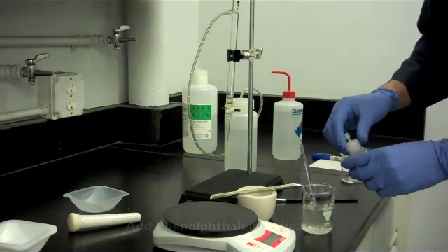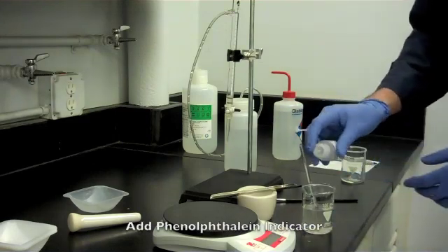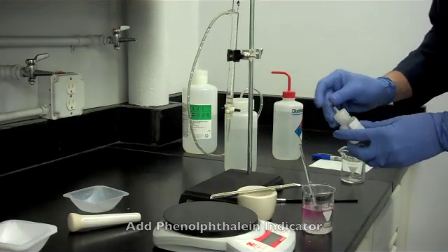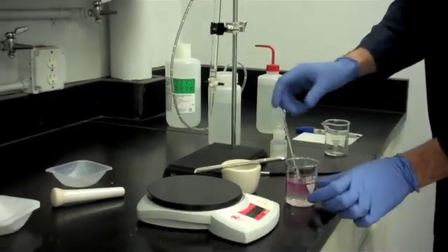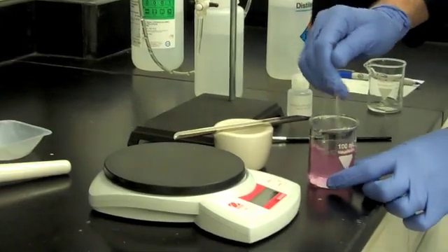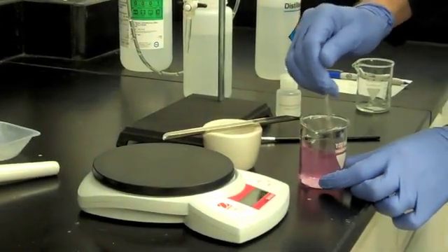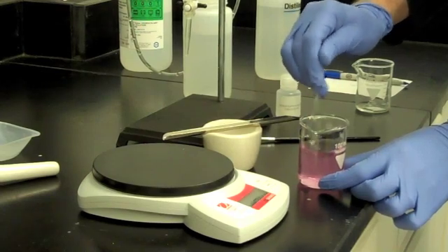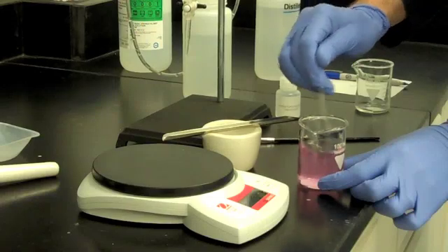When our salt is in solution, add 2 drops of phenolphthalein. Upon addition of the phenolphthalein, if the color of the solution remains colorless, sodium oxide is not present and your bath does not need rectification.